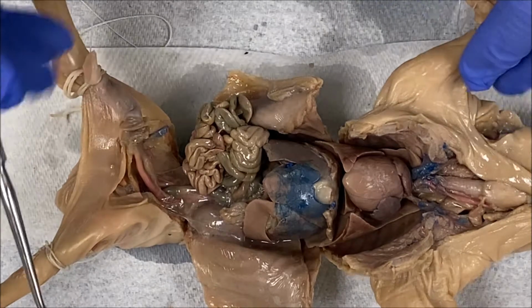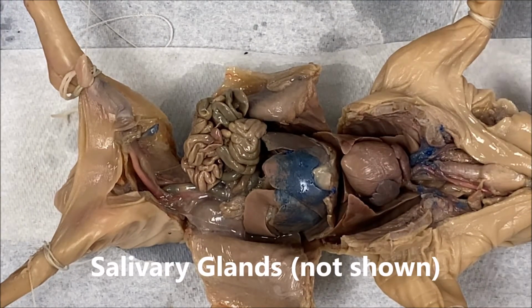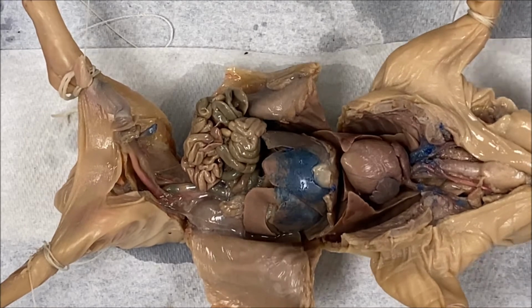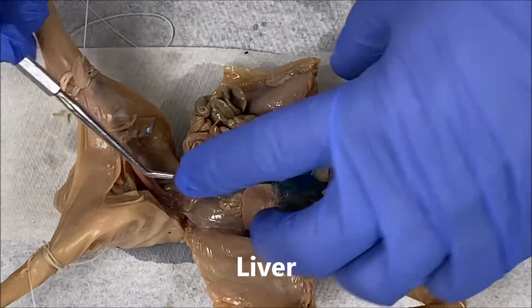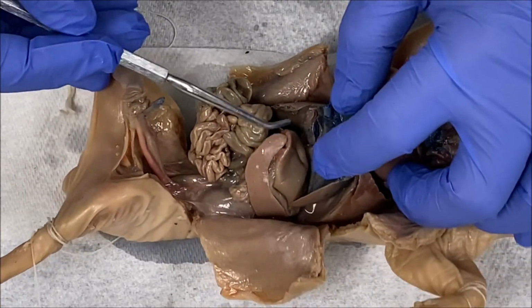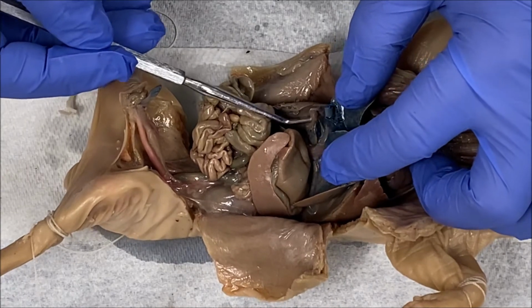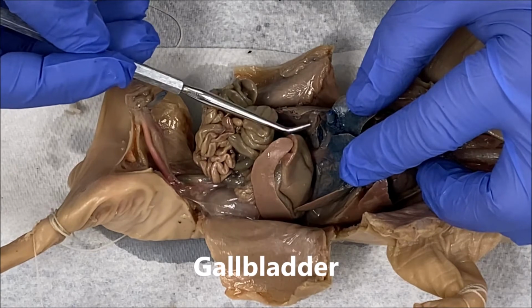Okay. So the accessory organs, right? The accessory organs of the digestive system would be the salivary glands, but we can't access those in this dissection. You have the liver, and then embedded in the liver, right? Embedded in the liver, you will find this little ball-like structure, this right here. This is called the gallbladder, okay?